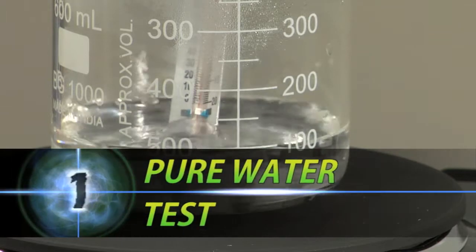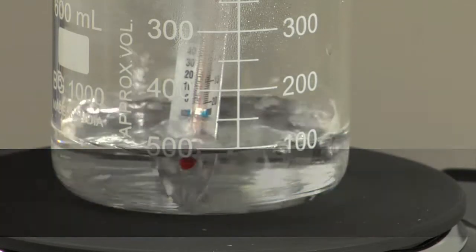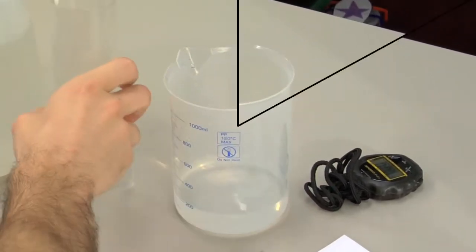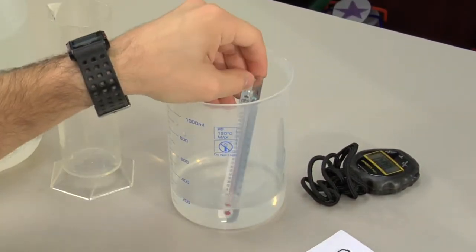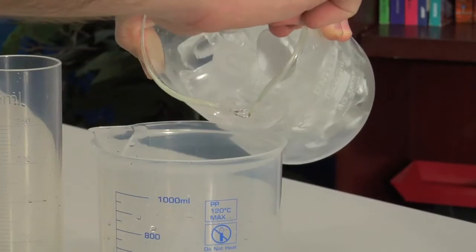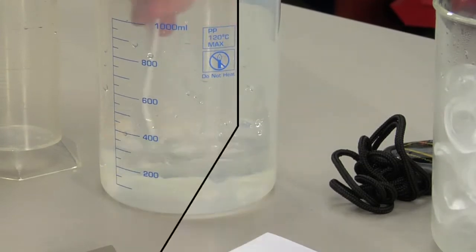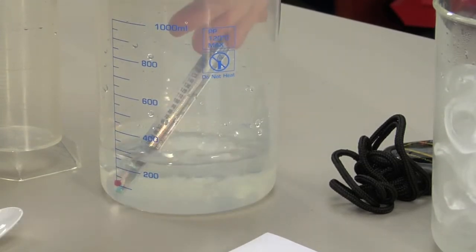Let's begin by testing pure water. Pour water into a beaker and record its temperature. Add ice cubes to the water and stir gently. Again, record the temperature of the water.